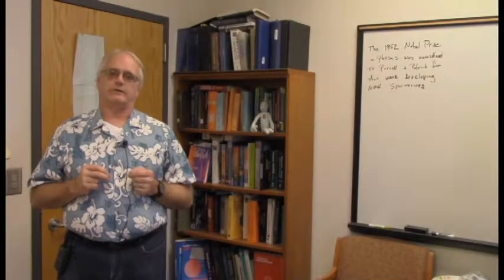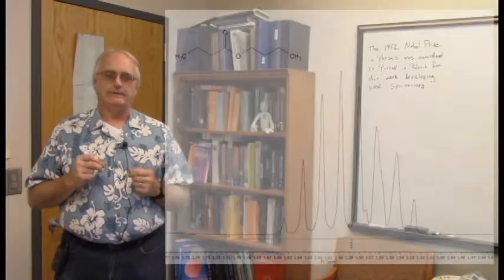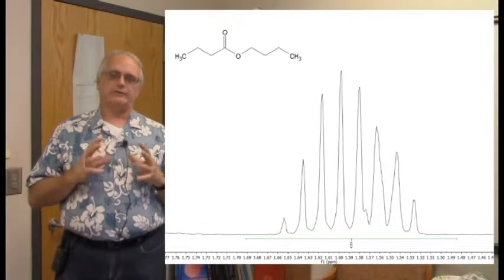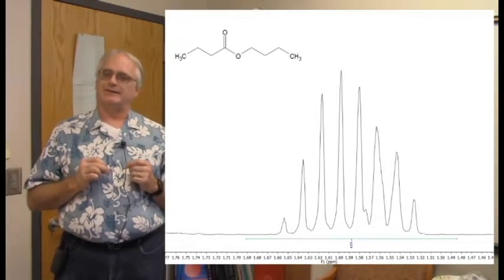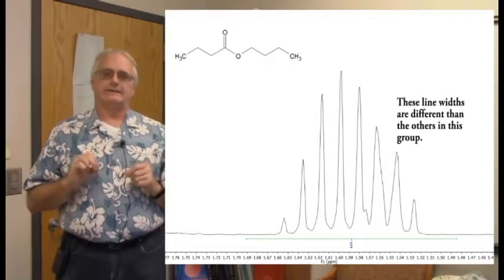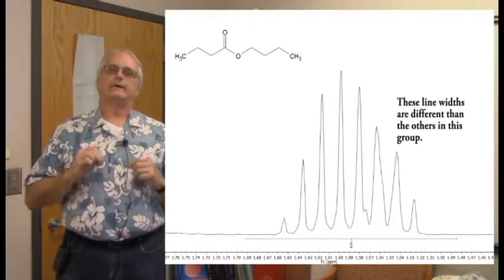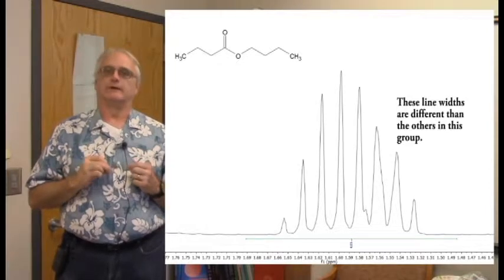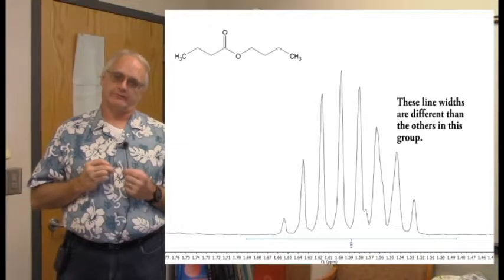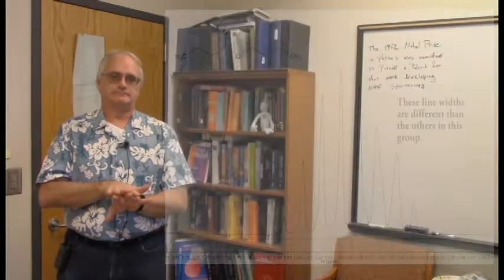And if we look at this particular signal, it does not have the textbook look of any classic doublet, triplet, quartet. And in fact, if you just look at it carefully, you could tell the line widths of part of this are not the same. Dead giveaway that this is more than one proton, unequivalent protons that just happen to have nearly the same chemical shift and are appearing over the top of each other in our proton spectrum.